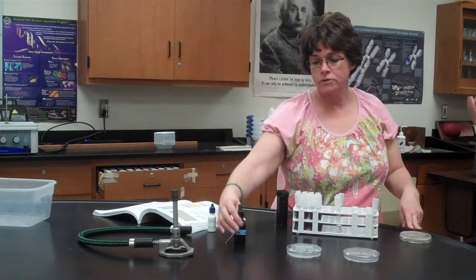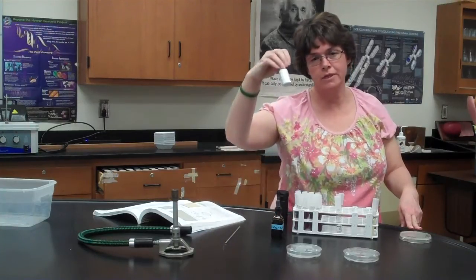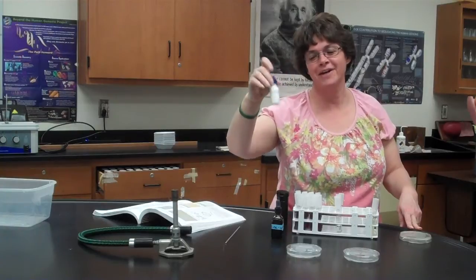You're also going to make a wet mount from the plates in that second week, and you're going to do it this time with iodine water solution instead of the lactophenol cotton blue. When I say that 3 times fast. Same thing, you just need to put a drop of the iodine on the slide. Then you get a small sample of your culture, put it on the slide, put on your cover slip to make a wet mount. So this is the lab for the yeast characteristics in reproduction.